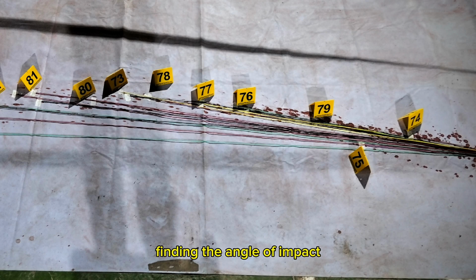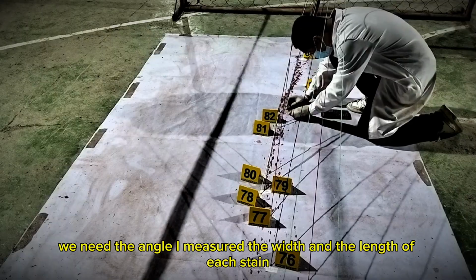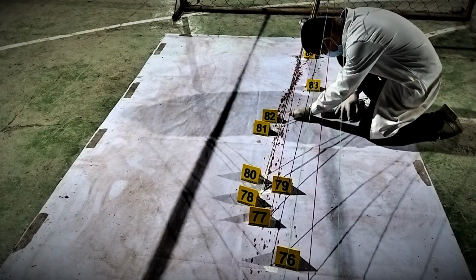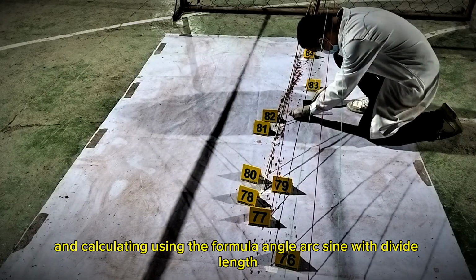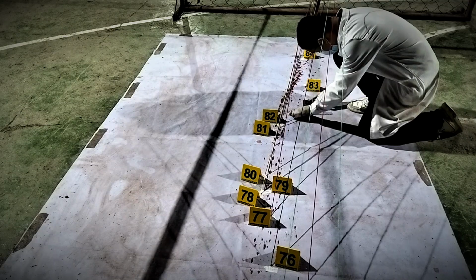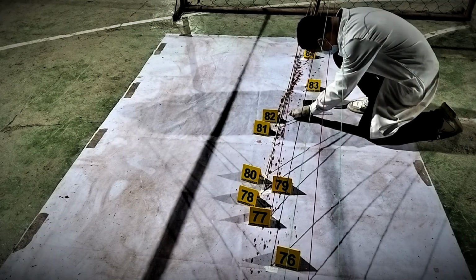Step 2: finding the angle of impact. Next, to determine the height, we need the angle. I measured the width and the length of each stain, and calculating using the formula angle equals arcsine of width divided by length, I determined the trajectory for each drop. This tells us how steeply the blood was falling.